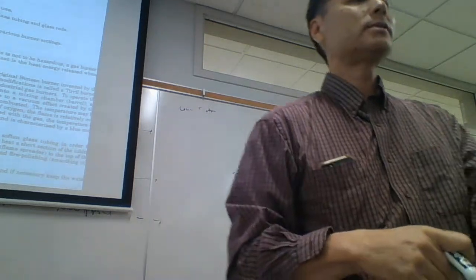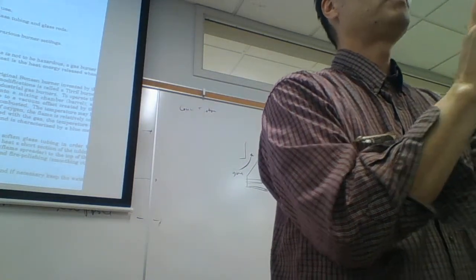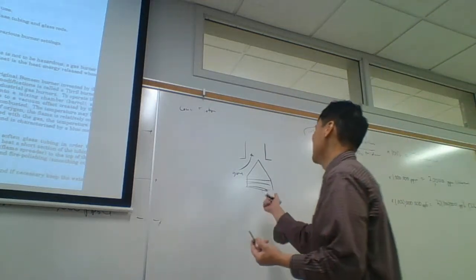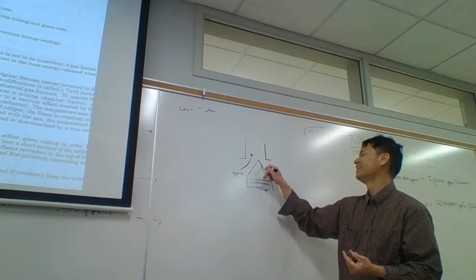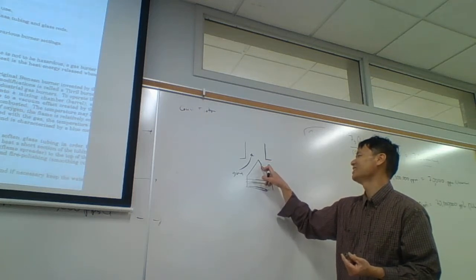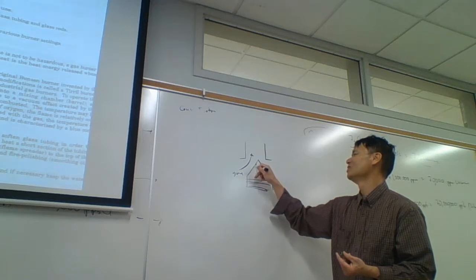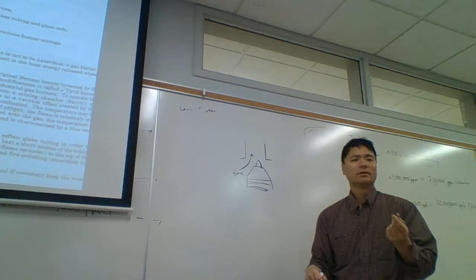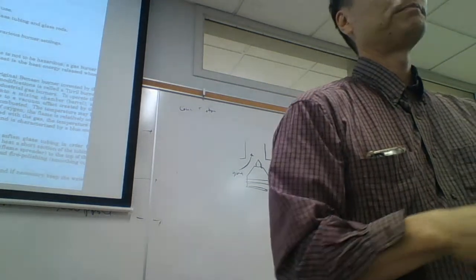But the problem is that people use this to shut off the gas. And when people use this to shut off the gas, they tighten it super tight against the seat and end up denting the needle. Do you see? Is your needle dented at the top? It's no longer a cone, but something like that. Do you see that? That's because people don't know how to use this properly.